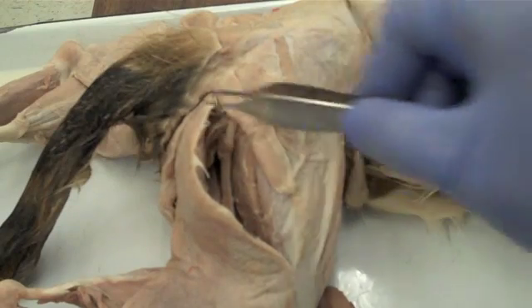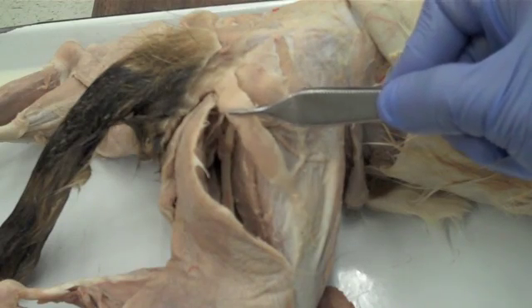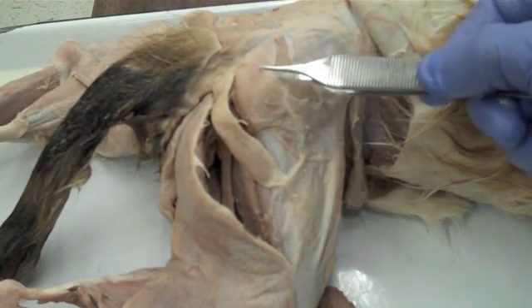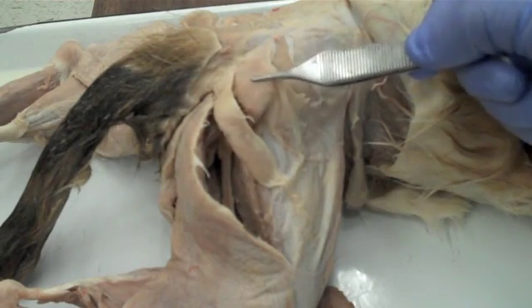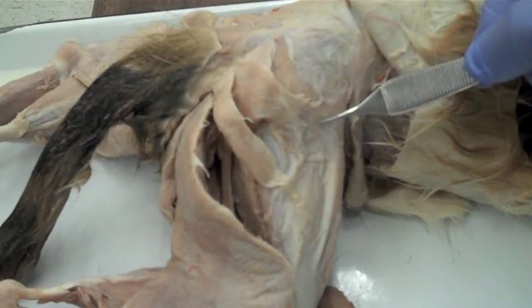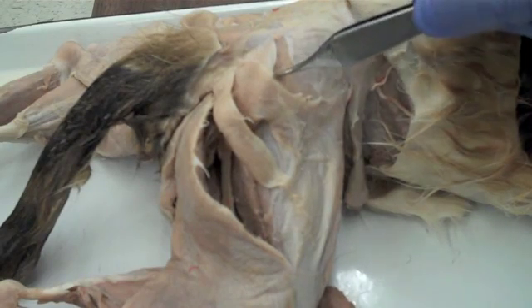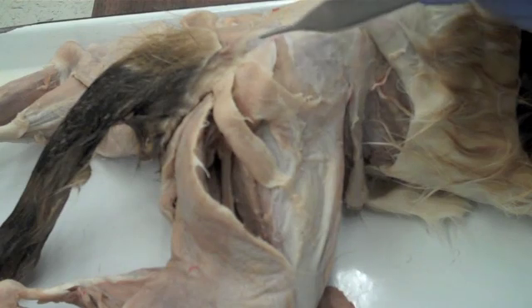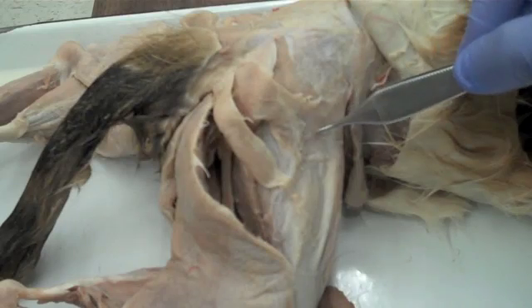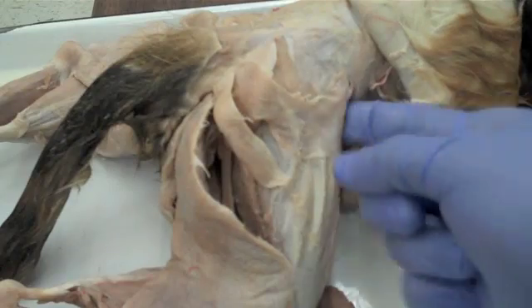Right next to the biceps femoris is a thin muscle called the caudofemoralis, found right here. Then we have the gluteus muscles — first the gluteus maximus, which is actually a rather thin muscle found right here, looping up in this manner. Underneath the gluteus maximus is the gluteus medius, visible in this area. And at the end of the gluteus maximus, if you follow the curve, you merge into the tensor fasciae latae, found right here.